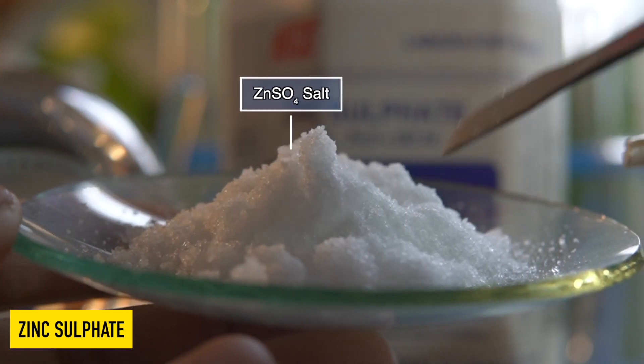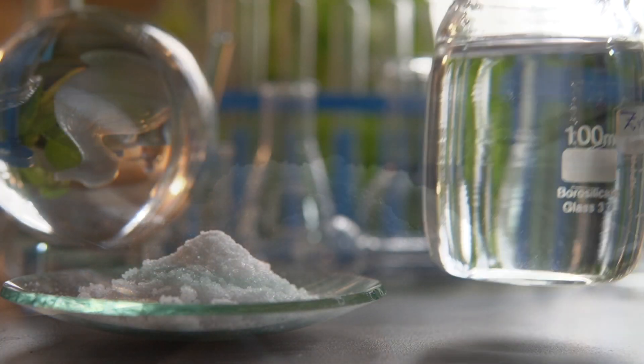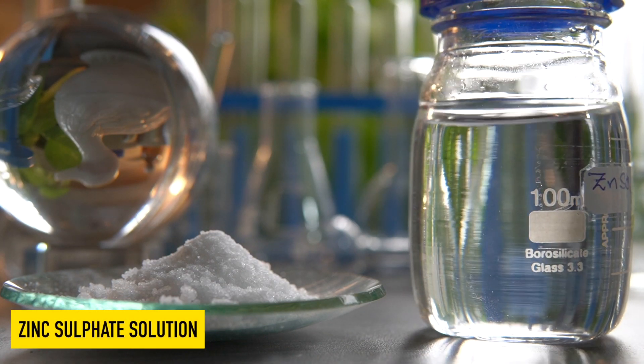This is zinc sulfate, a white crystalline solid, and it's highly soluble in water.